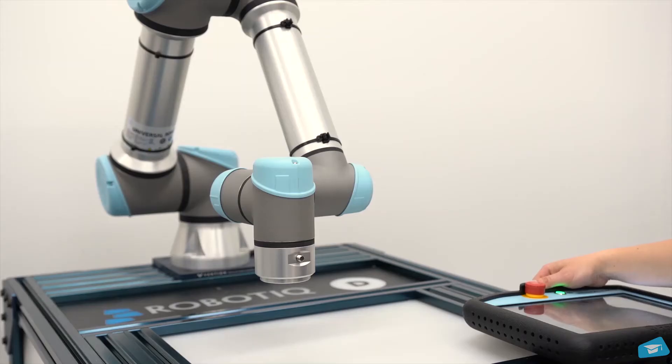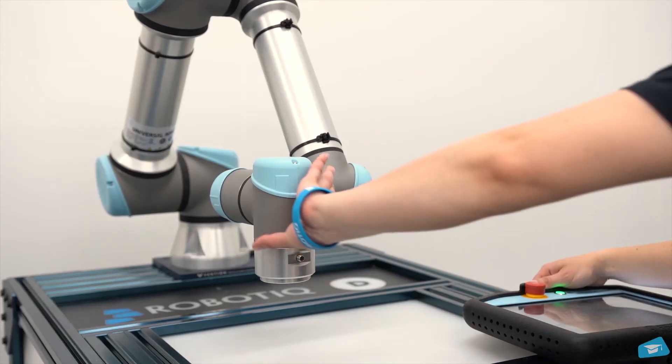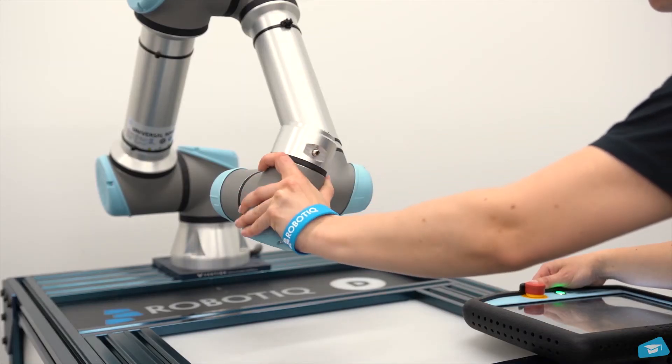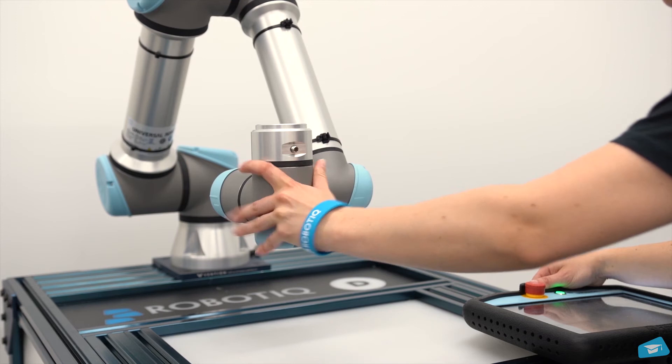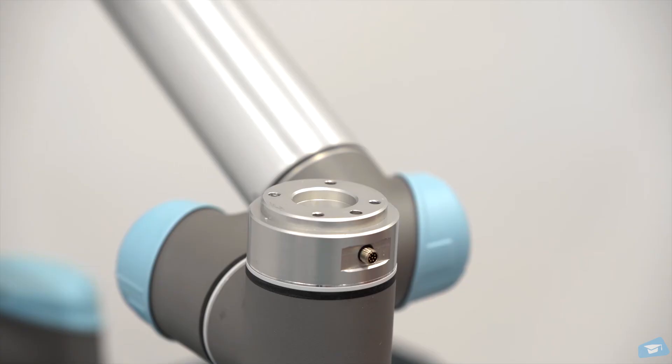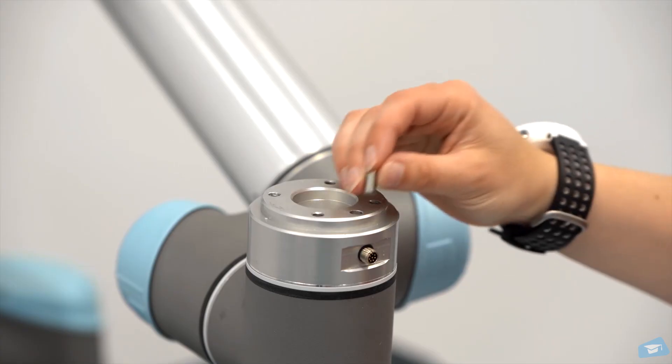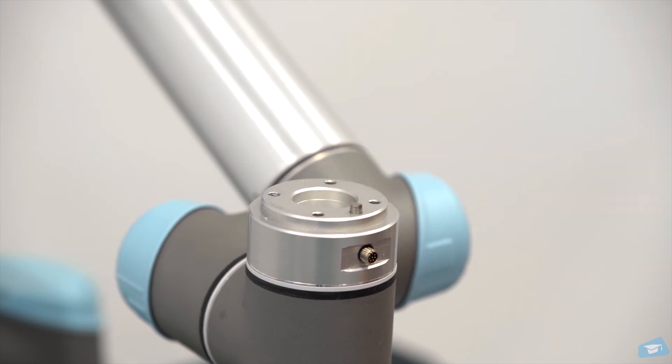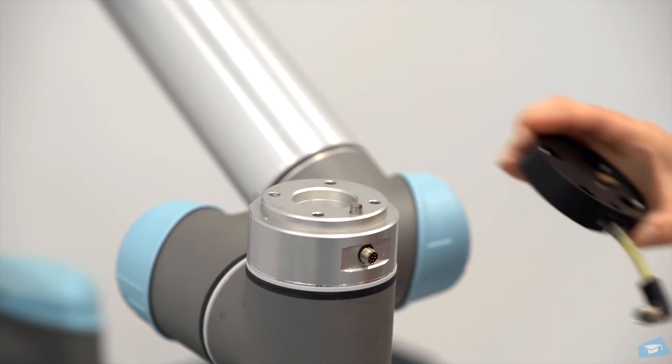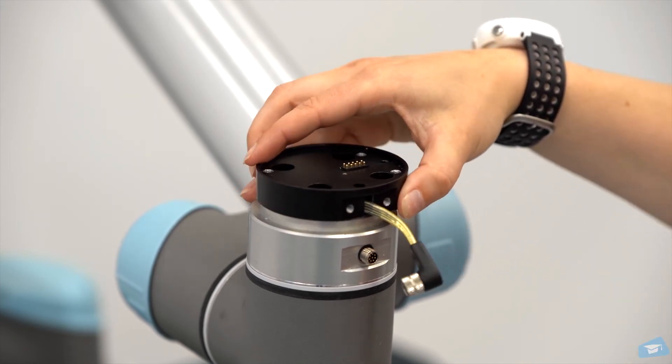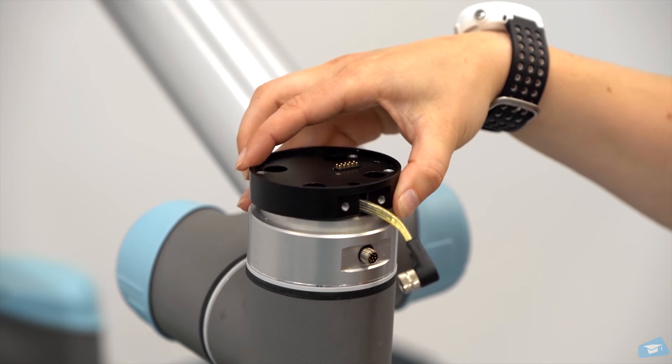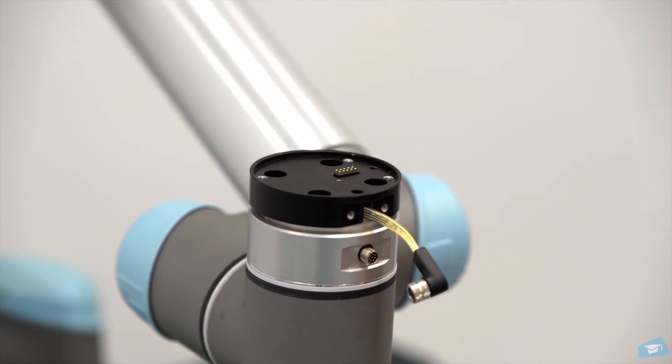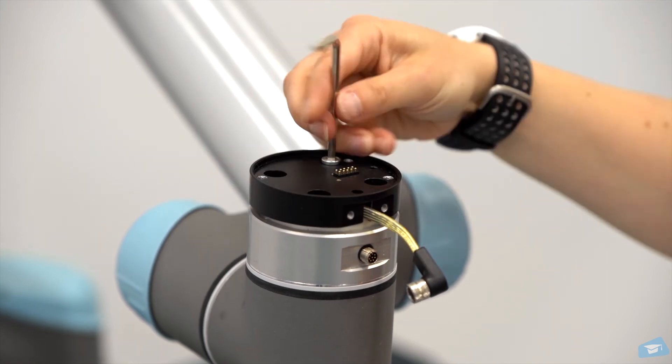For a smoother yet easier assembly experience, you can position the robot's wrist in a positive Z-axis position. Insert a dowel pin. Mount the coupling on the robot's wrist with the provided M6 screws and tooth lock washers.